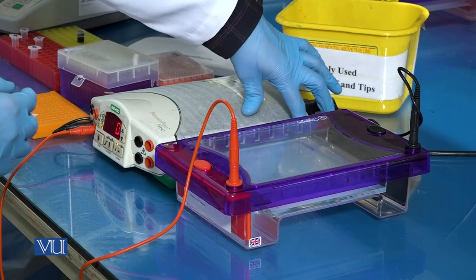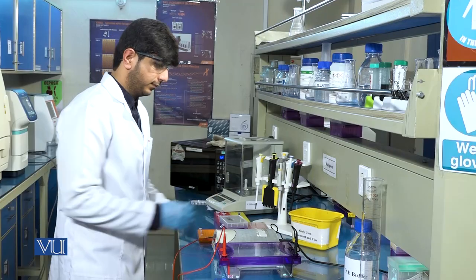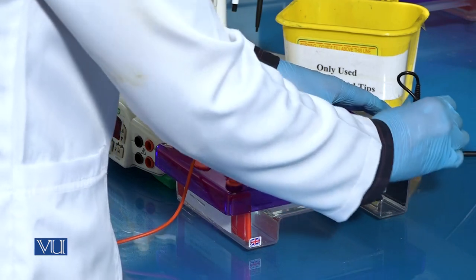When gel run will be completed, turn off the power supply and take the gel out of the tank.